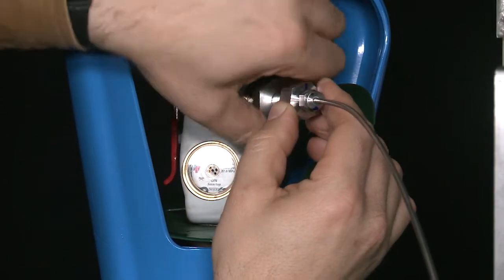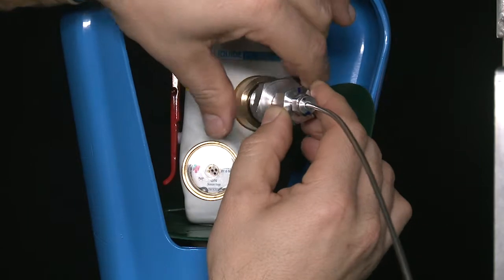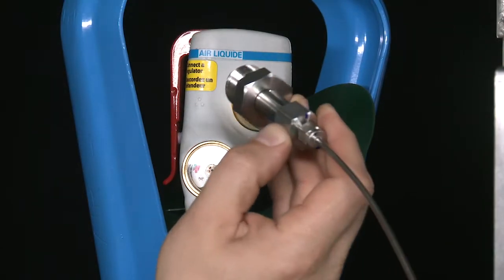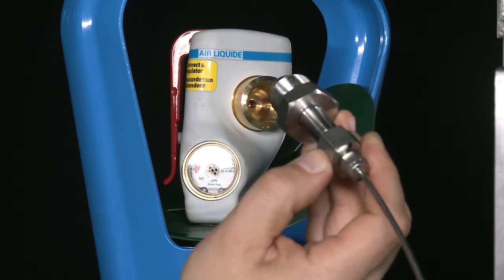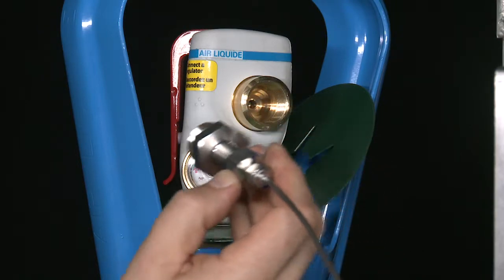Note: if the fitting is a DIN-6 or a DIN-10, be sure to replace the PCTFE gasket with a new one.